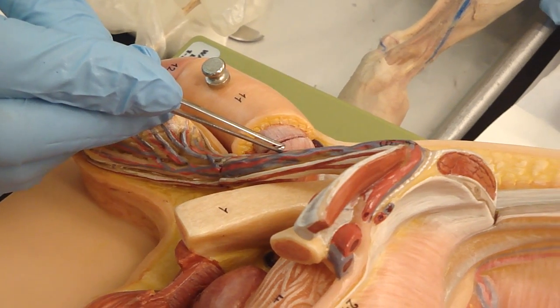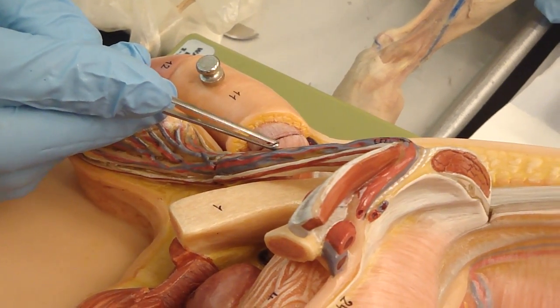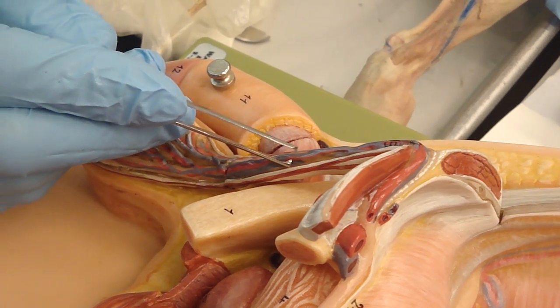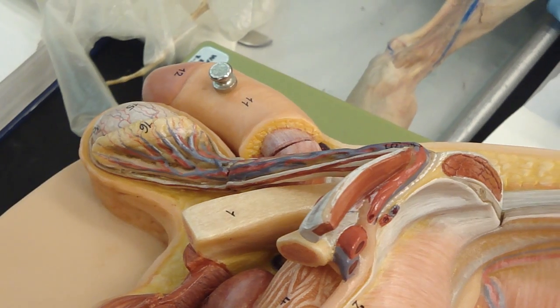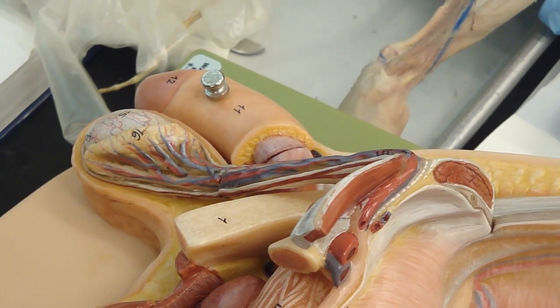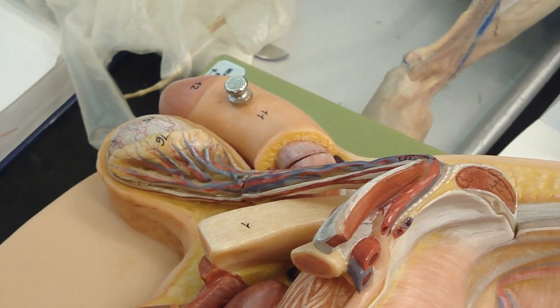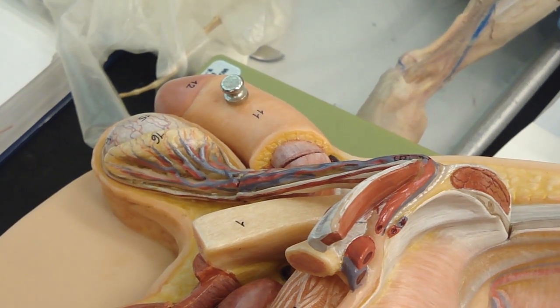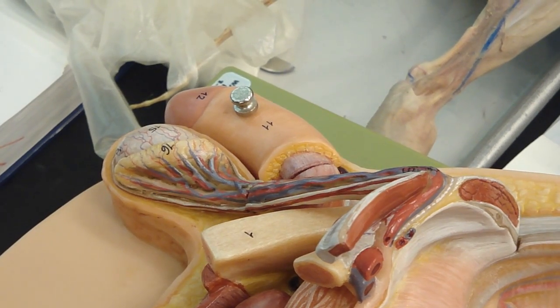Gonadal? Gonadal artery, sometimes called testicular artery. Gonadal or testicular artery, going down there. There is a vein, a plexus, coming back up, a venous plexus, called the pampiniform plexus. So here's the artery, here is the pampiniform plexus of veins wrapping around it. What does that remind you of? Artery going this way, veins wrapped around an artery. What is that? Here's the clue I gave the last lab. Duck's feet.